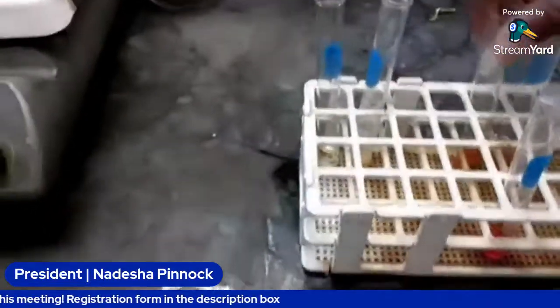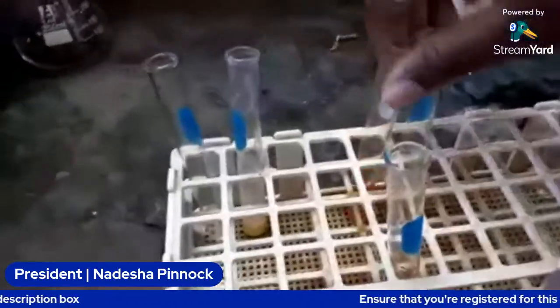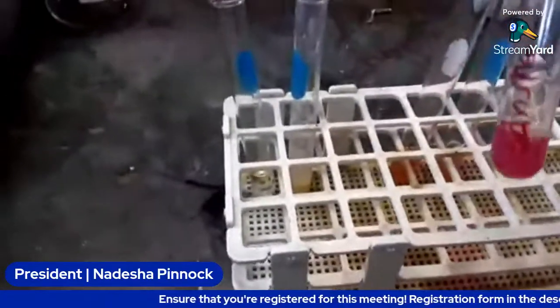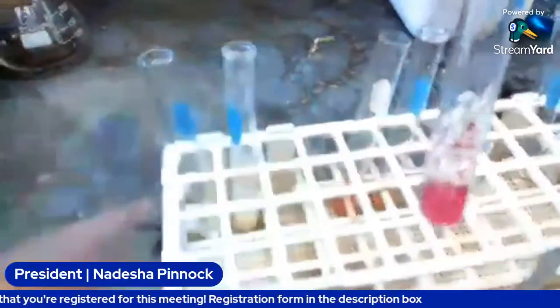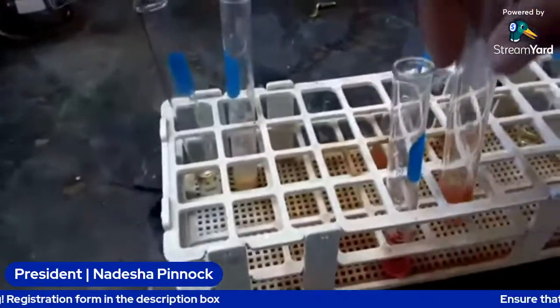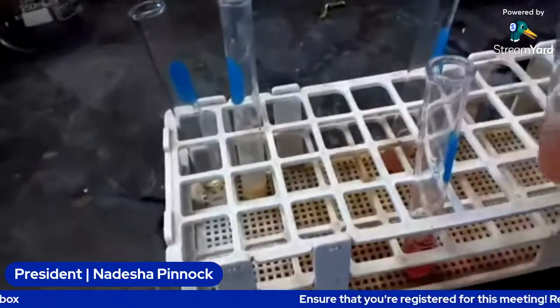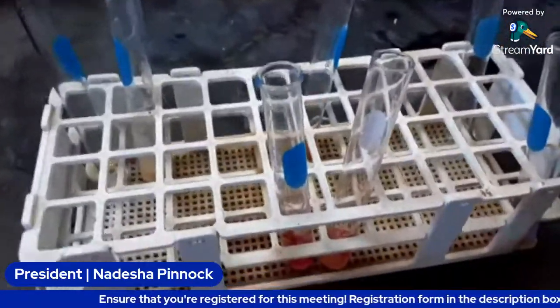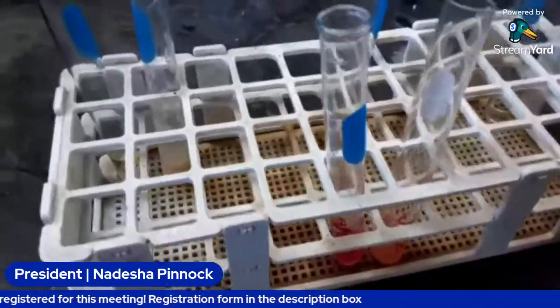All right. So we labeled the juice as well as the syrup. We're going to do a Benedict test on these as well. So this is the syrup and the juice. We're going to do it simply by adding the Benedict reagent to it first, and then we observe changes.